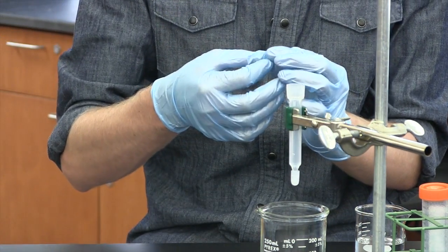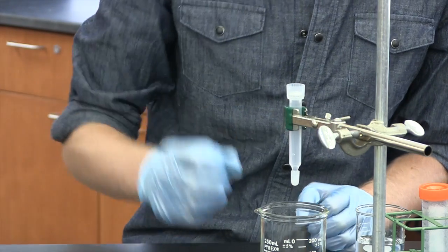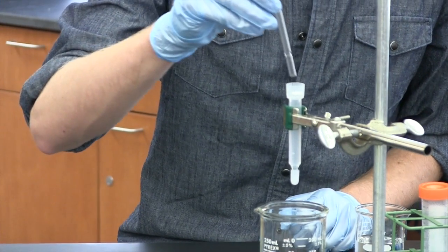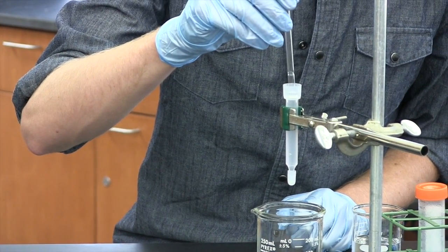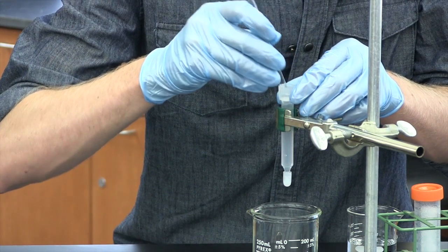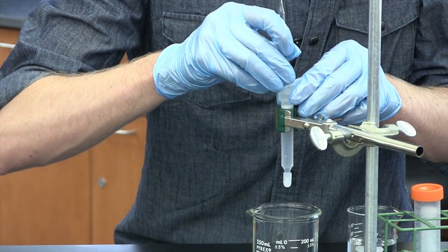You can drop it in there, let it soak the buffer up, and you'll use the back of a pipette to push it down to the bottom. It's a little tricky because sometimes it gets stuck in there at an angle, and then it's hard to jam it all the way down.